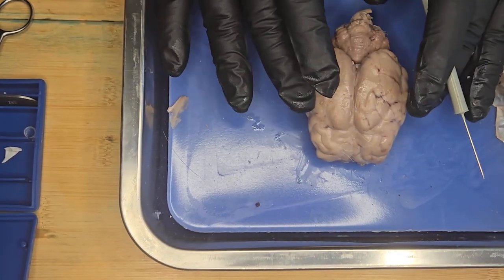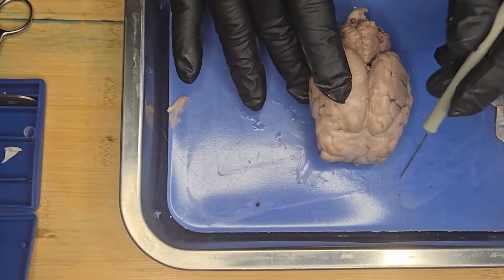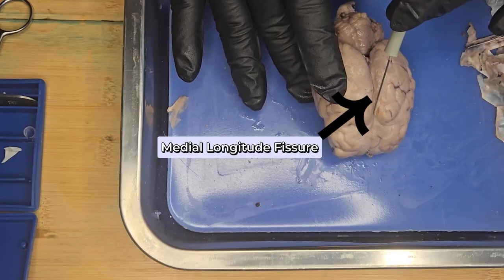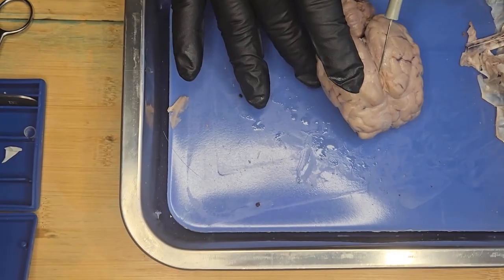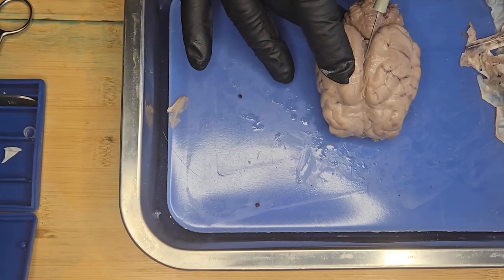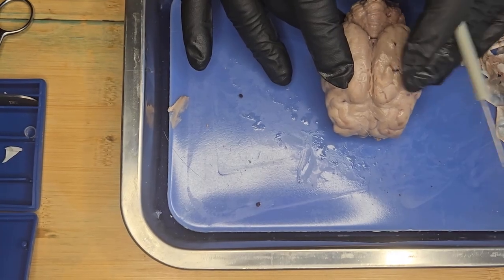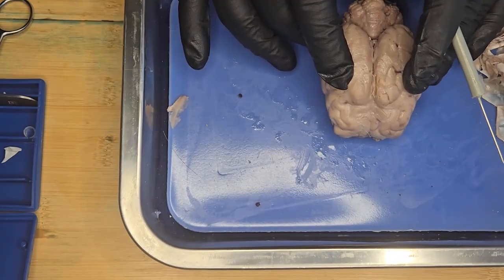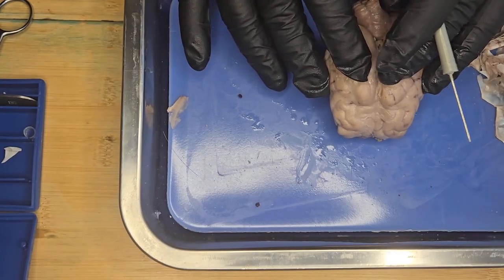The two hemispheres, the left and the right, are divided by this central canal called the medial longitudinal fissure, which is a deep groove that runs lengthwise and separates the right and left cerebral hemispheres. And it helps organize nerve tracts symmetrically.